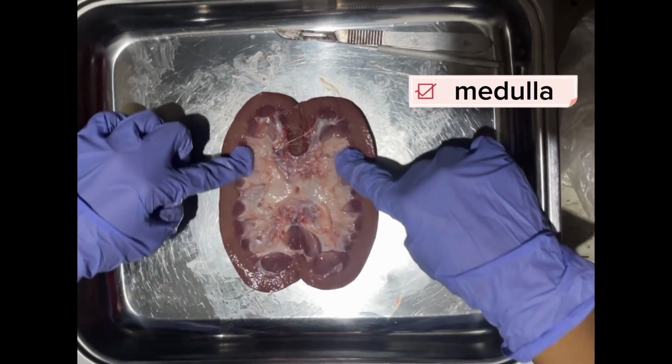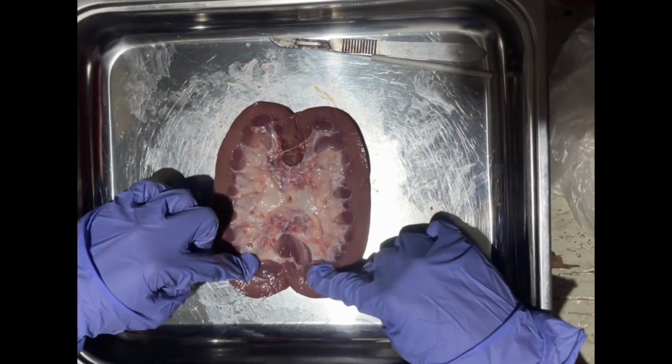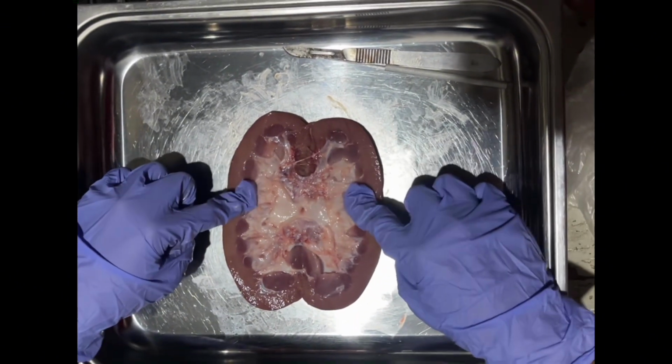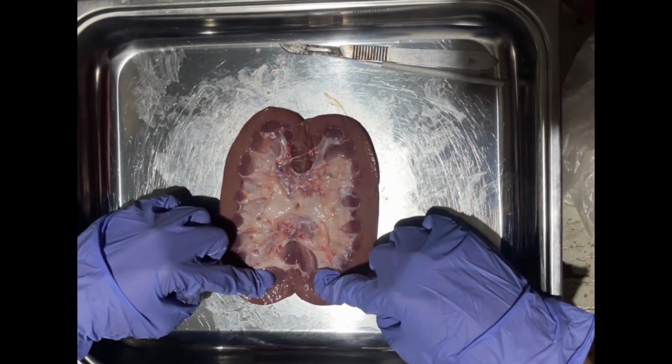These are the fibrous or triangular zones in the medulla that contain the collecting ducts, which collect the urine from the kidney tubules of the nephrons in the cortex. It is also the region located inward from the cortex. It includes the cone-shaped renal pyramids.